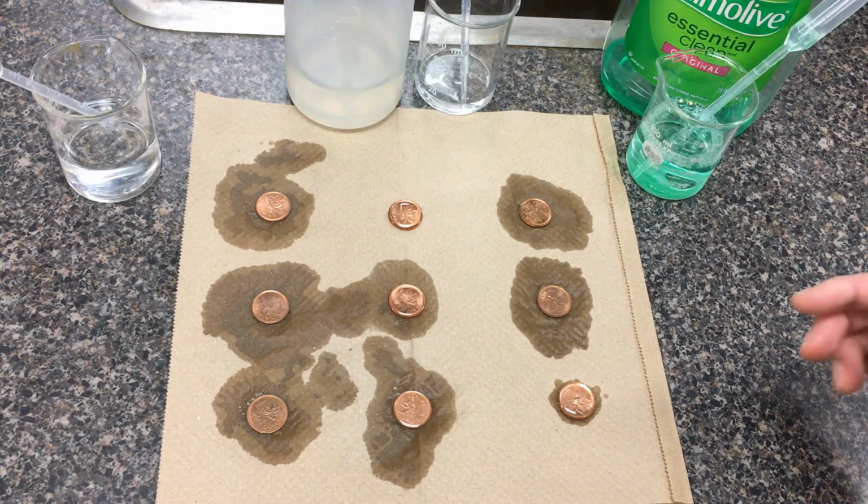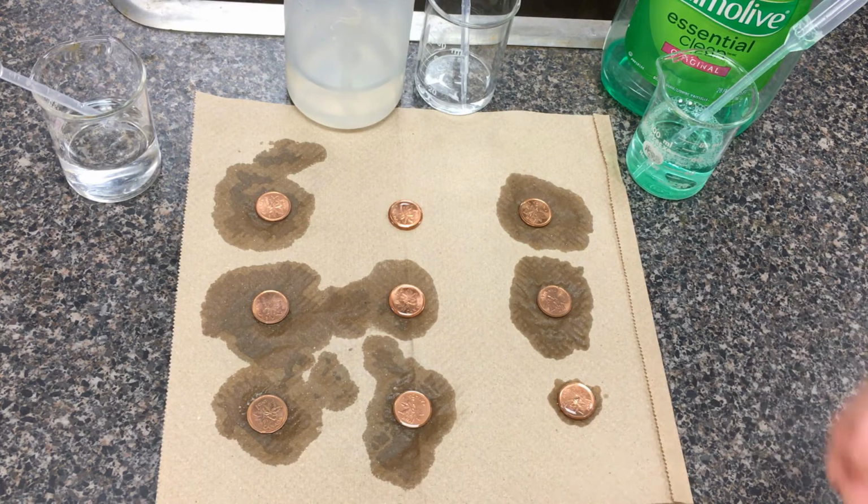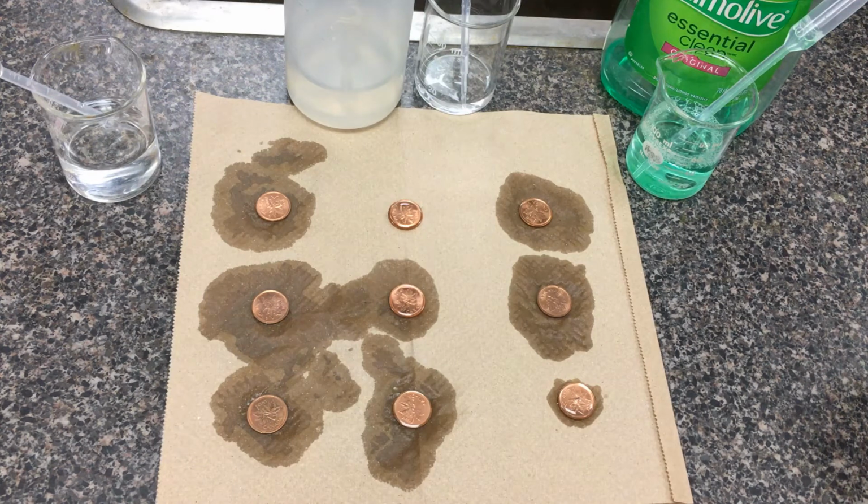Again, if the droplet number varied between the different trials, it may be good to actually redo that trial. In chemistry, we try to do what's called a 5 by 3, so 5 different measurements. If I were testing 5 different solutions, those would be the 5, and for each solution we do 3 trials. Again, nothing magical about that number 3. If it's too varied, you can always do another trial.